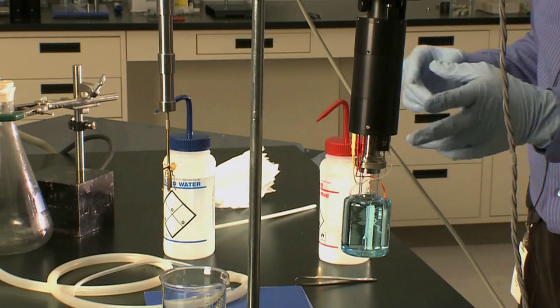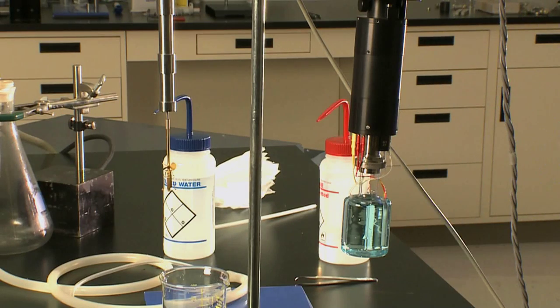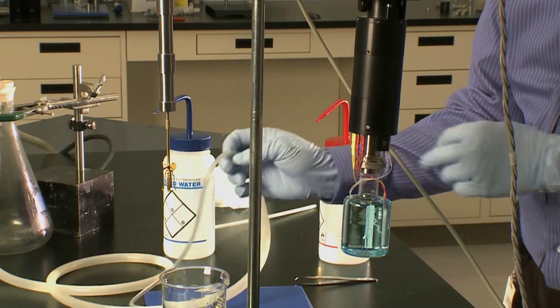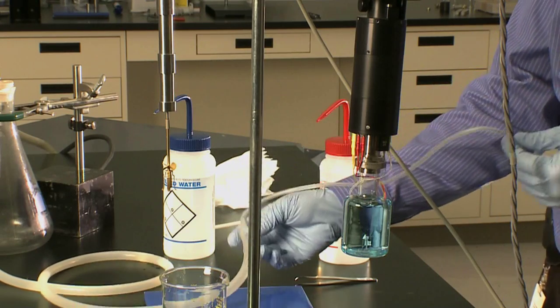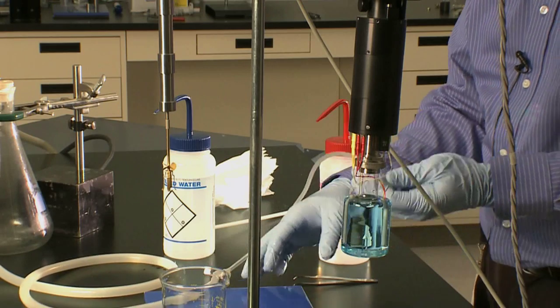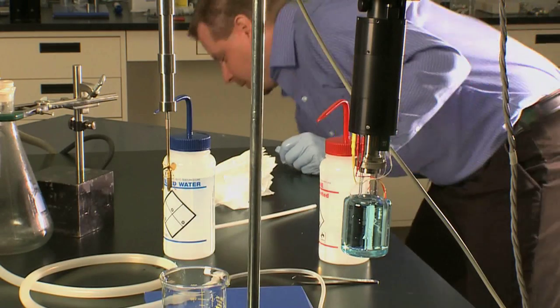Now that the stirrer is clean, we have to clean the vessel. We use a vacuum line connected to a vacuum flask with the silicone rubber tubing that was provided with your solution calorimeter. I'll turn on my pump.